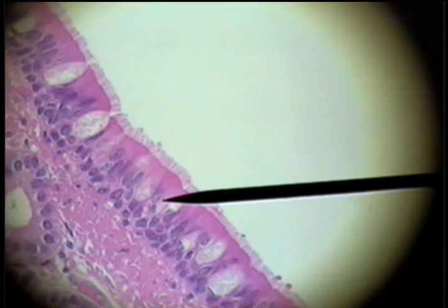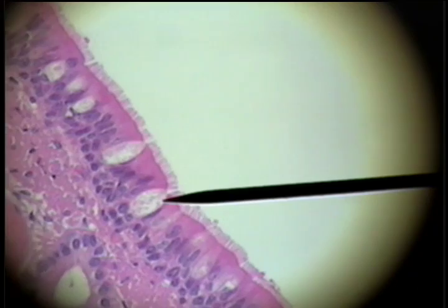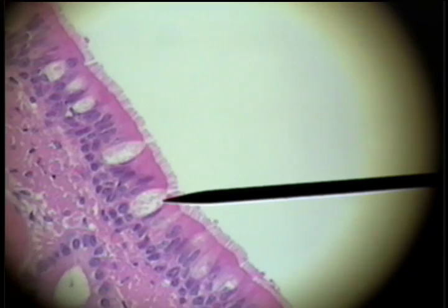we can distinguish that these are pseudo-stratified ciliated columnar epithelial cells, and then every so often we see one of these goblet cells with its theca filled with mucus. This is ready to be expelled to the surface to moisten the surface of the respiratory tract.